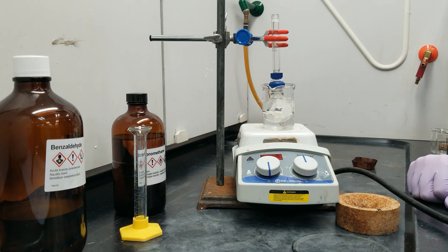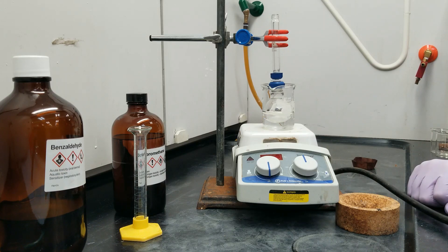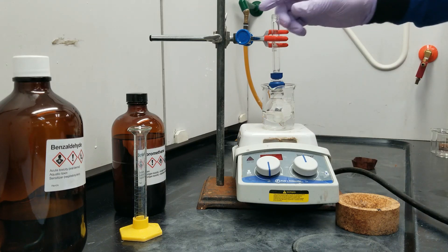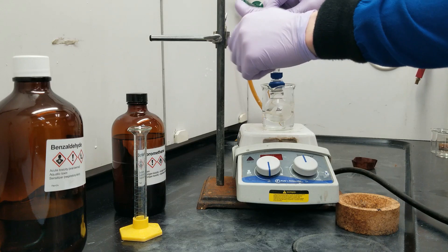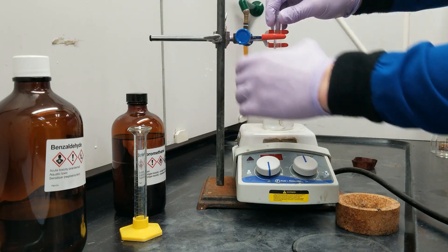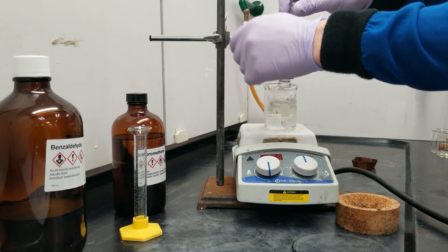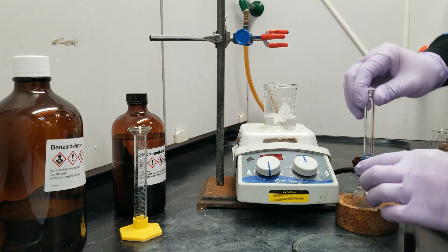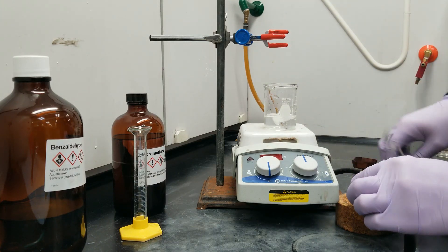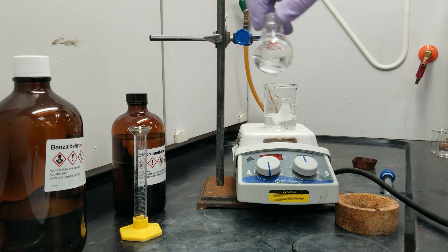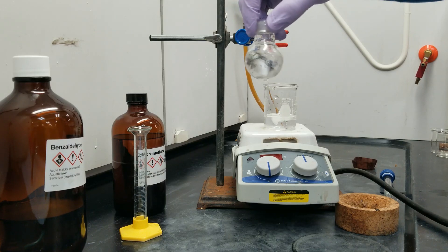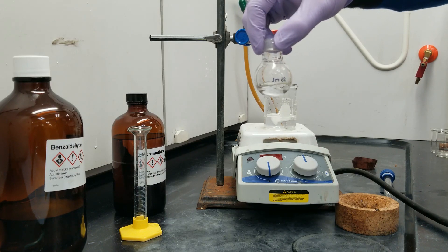Okay, so we're back after about 10 minutes, and the reaction has completely finished at this time. So now I'm going to take the reaction off. It looks exactly the same because a lot of organic chemistry is just mixing clear liquids with clear liquids.